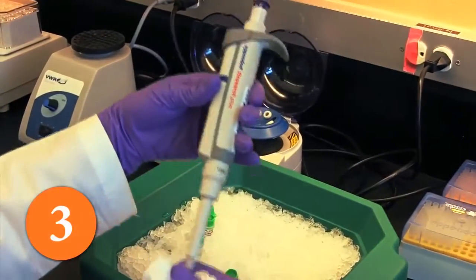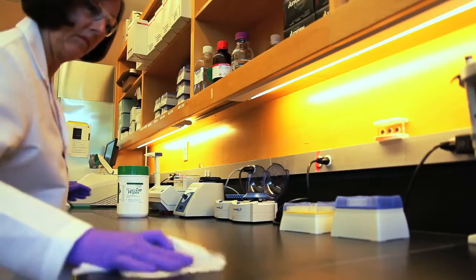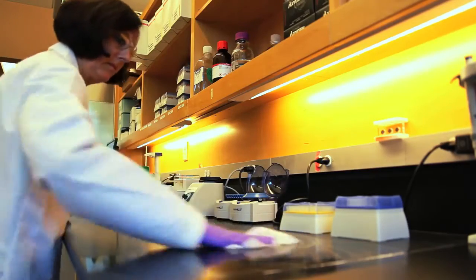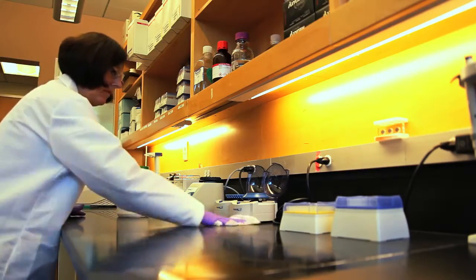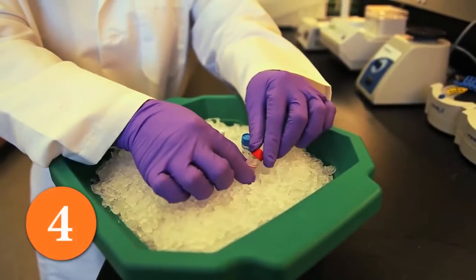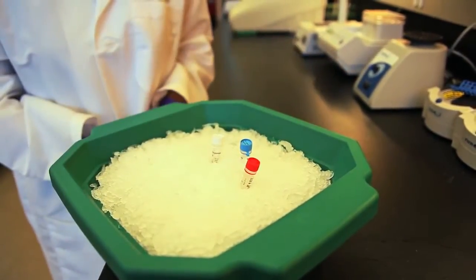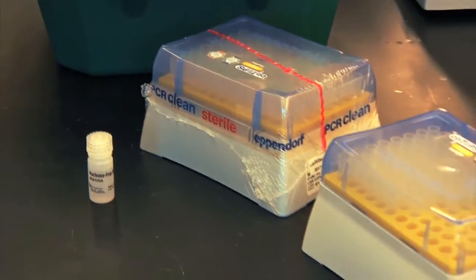Aseptic technique should always be used when working with RNA. Hands and dust particles may carry bacteria and mold and are the most common sources of RNase contamination. Make sure you clean your working surfaces with RNA Zap or a similar product, and make sure you change your gloves frequently. To further minimize contamination, keep all sample and reagent vials capped when not in use. Use RNase and DNase-free plastics, water, and solutions.